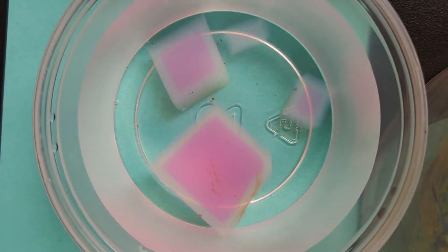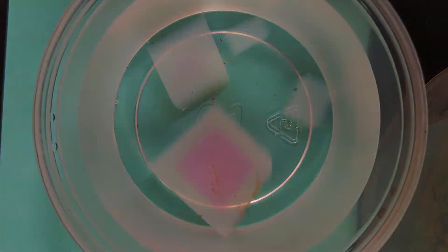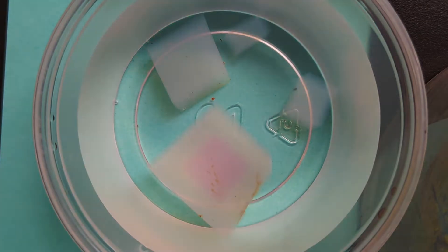So we can use these model cells to observe the rate of diffusion and osmosis. It's interesting to see the importance of the surface area to volume ratio in these cells — the smaller cells have a better ratio, so diffusion and osmosis have run throughout the cell, whereas the largest cell still has a lot of its cytoplasm unreached. That illustrates the importance of a high surface area to low volume.